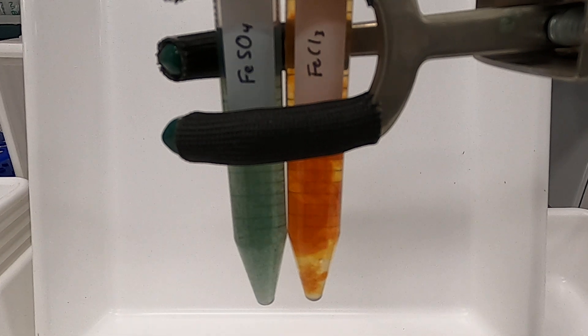So what we see now is that there's clearly a solid precipitate in each tube and some obvious color differences between those two precipitates.